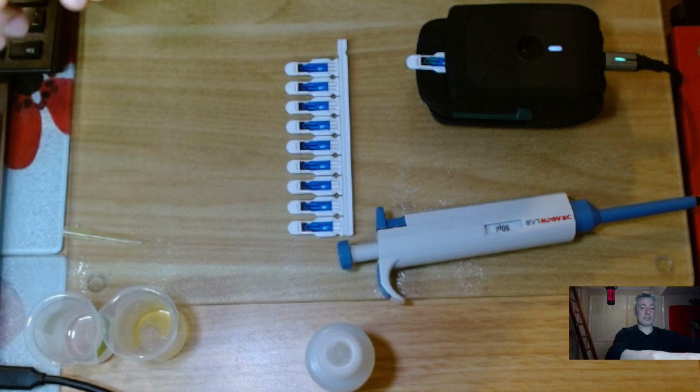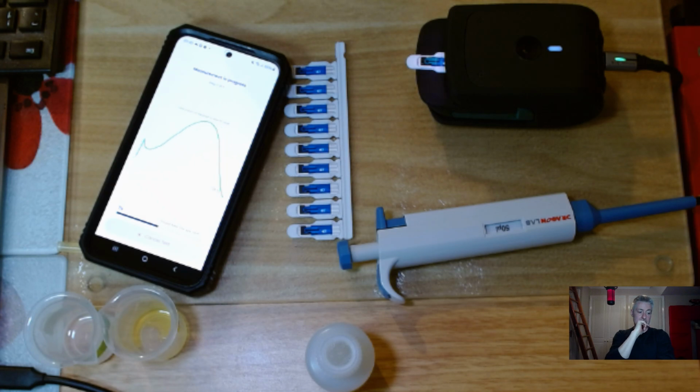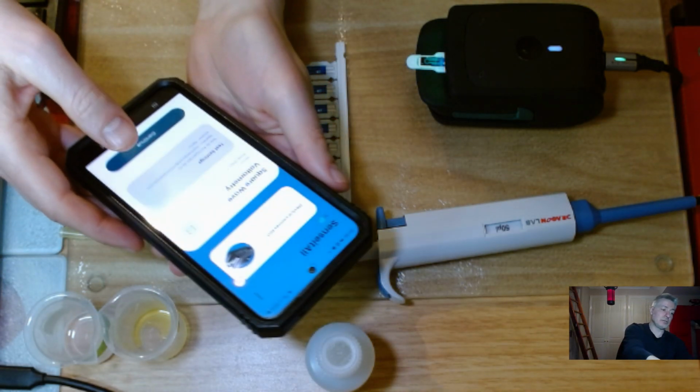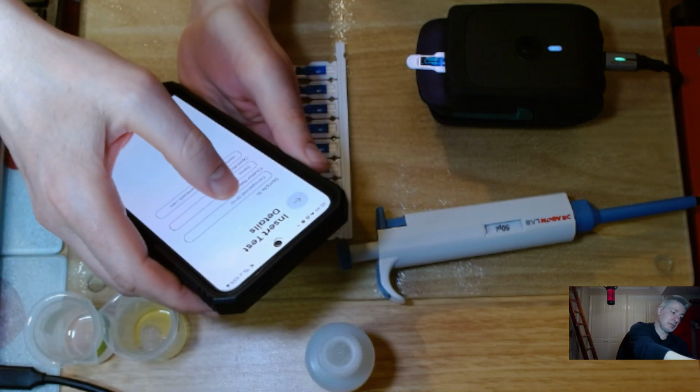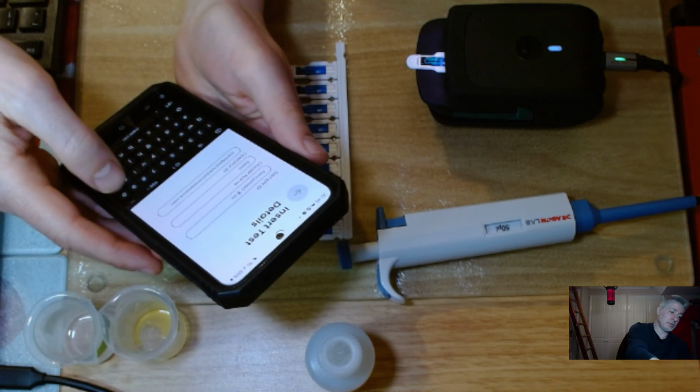Right, and now it's only going to take about 14 seconds to do that. I'm now gathering essentially the same experiment, but at a much faster frequency. There we go. Right, done. Now I'm going to set it to 100 hertz. So I've changed the file name to 100 hertz.